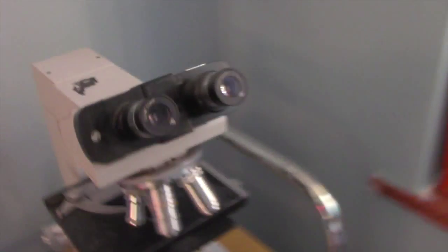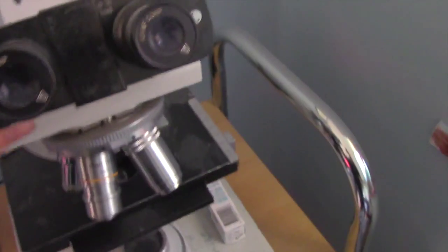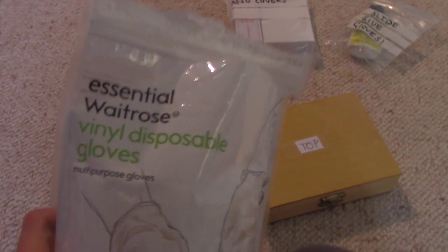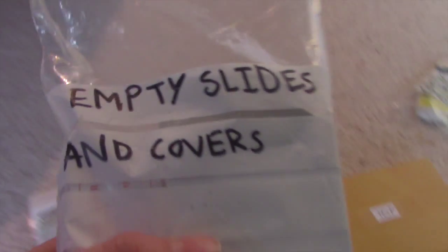Hello and welcome to Science Shed! Today we're going to be making some microscope slides using my microscope, which I got for my birthday two years ago. We've got David and Dan with us today. To make the microscope slides we've got vinyl disposable gloves, empty slides, slide covers, and glue. The gloves are for the glue because the glue is toxic to your skin.